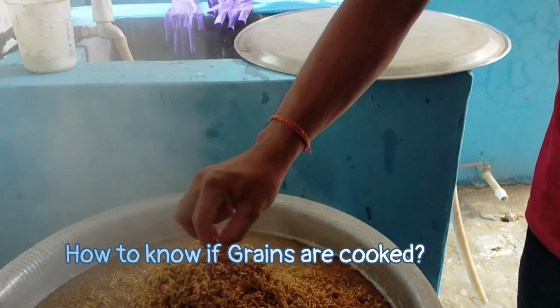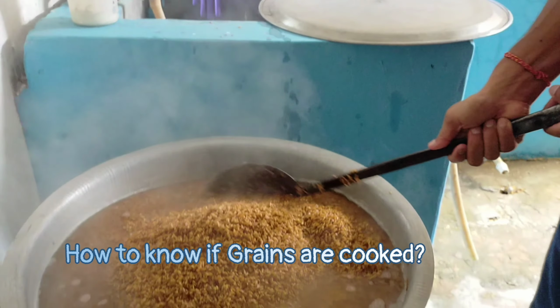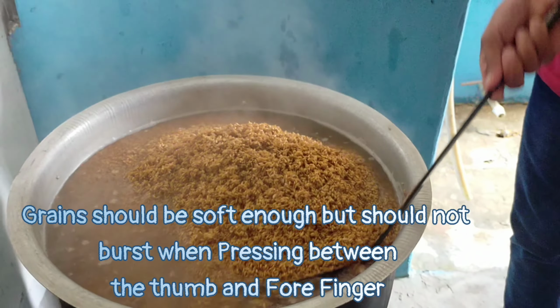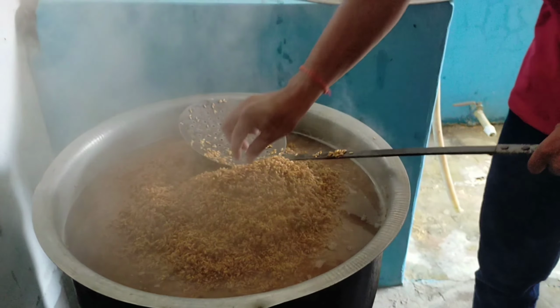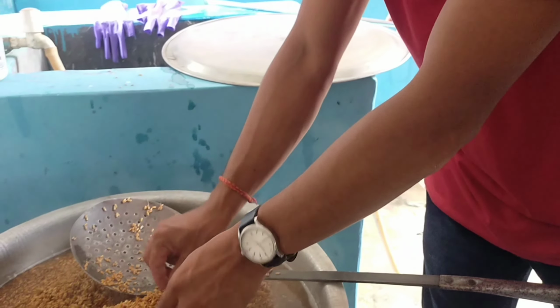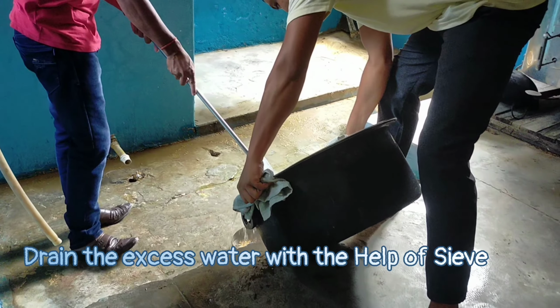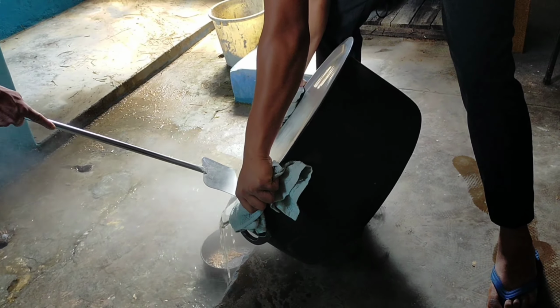One of the best methods to check whether the grains are ready or not is by taking a grain and pressing it between the thumb and the forefinger. It should be soft enough but should not burst while pressing the grains. As you can see here, now we are taking the grain and pressing between our fingers. See, this is how you will know whether the grains are cooked or not. And now what we're gonna do is drain the excess water.